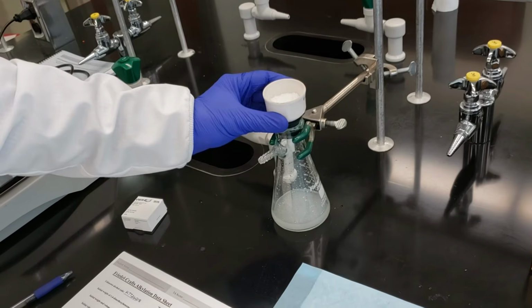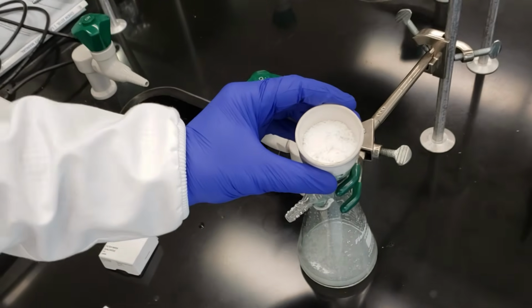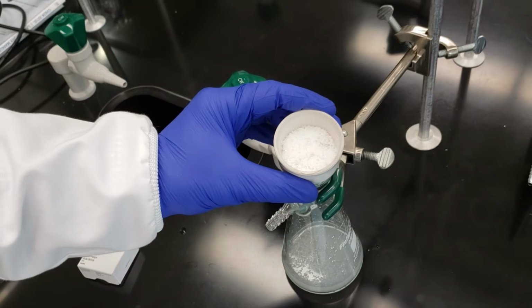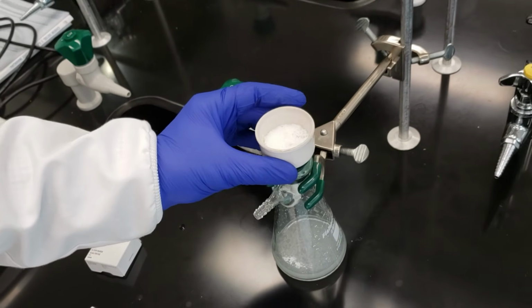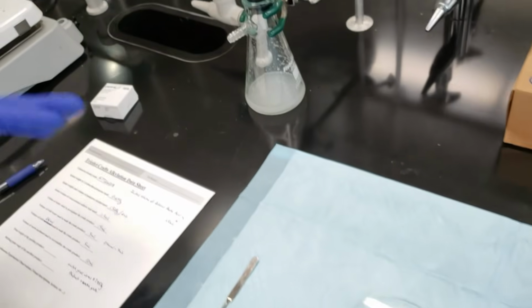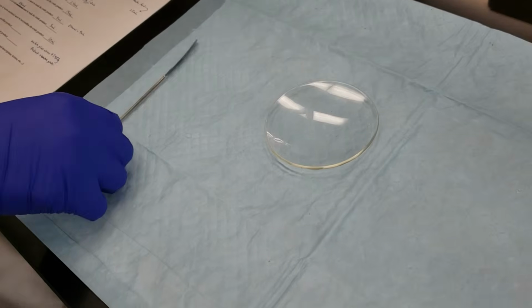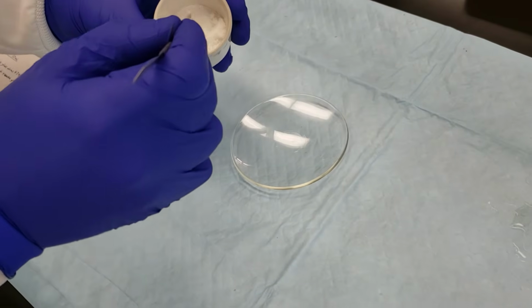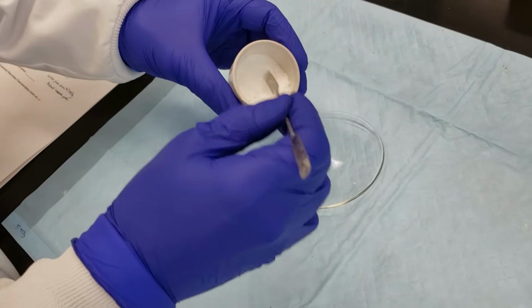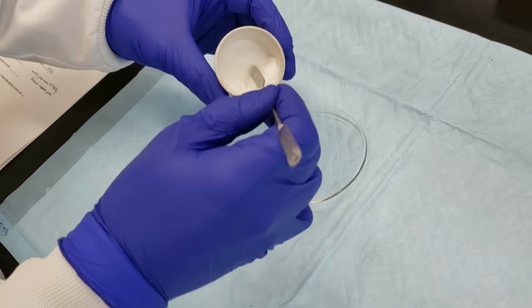So we finished pulling air through our product crystals. They're looking fairly dry, but we know that there's still some moisture in them. We did use water to rinse them down into the Buechner funnel. So we're going to scrape them off onto a watch glass, pre-weighed. We've already got that written on our data sheet that we'll show you in just a minute. But we'll go ahead and get these scraped out, and we'll put them into the drying oven for a little while. They're coming off really nicely though. These are fluffy white crystals.